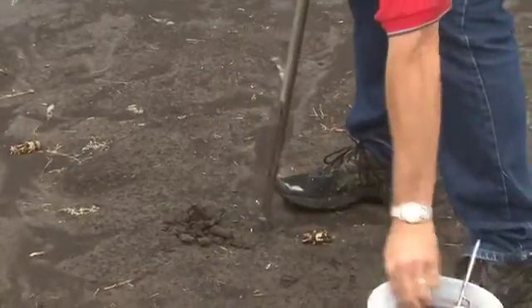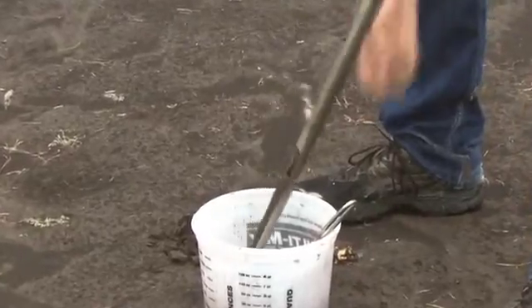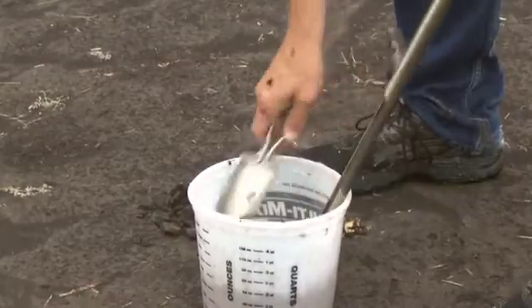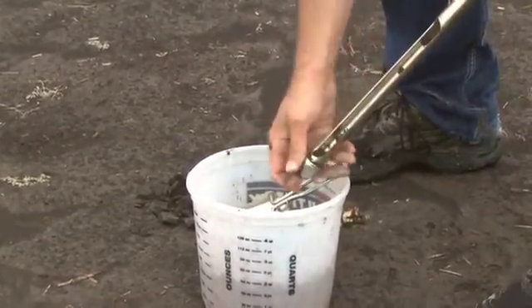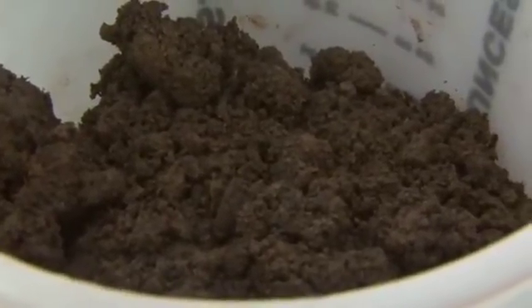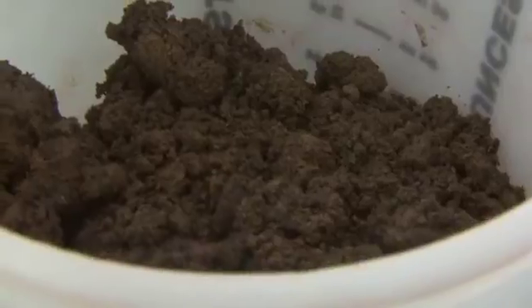You're going to collect those samples and place them in the bucket. Once they're in the bucket, your samples are ready to go for all those various tests. The big thing is do not let it totally dry out. You can put them in a bag if you need to, but you've got to keep them somewhat moist. However, if you keep them moist for too long, they'll start changing in property, so you want to do your tests fairly soon after sampling. A technique you can also use is refrigeration — once you sample, you can put them in a refrigerator and it'll be a little more accurate.